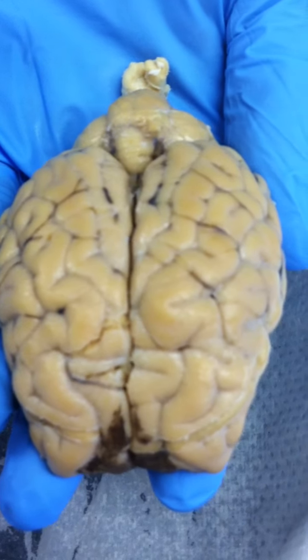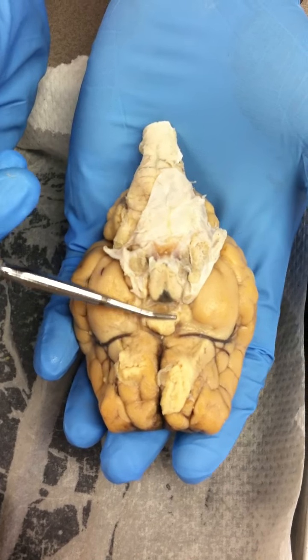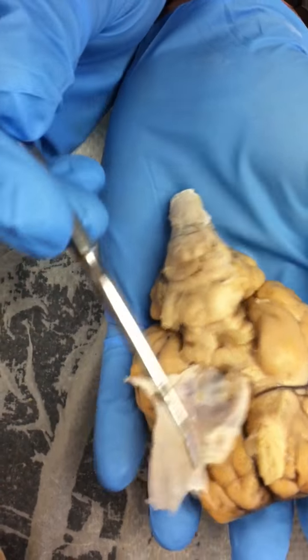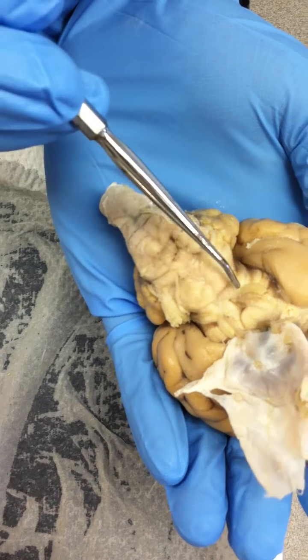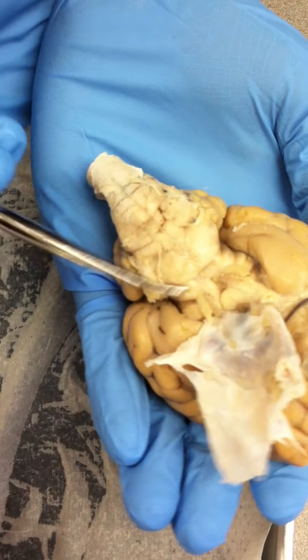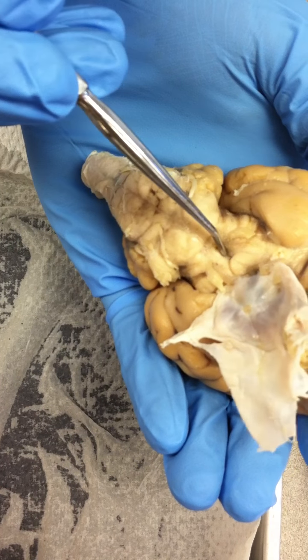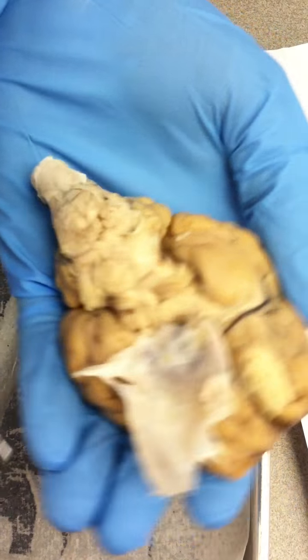And then the midbrain on the bottom is this whole thing. Because it's 3 parts, right? So in the midbrain, we have the cerebral peduncles, on both sides. No, this is the nerve. Cerebral peduncles is what it's attached to. You see how there's this side and this side. Trace it, and right there in the lower quadrant, cerebral peduncles. Kind of looks like a butt cheek from this angle.